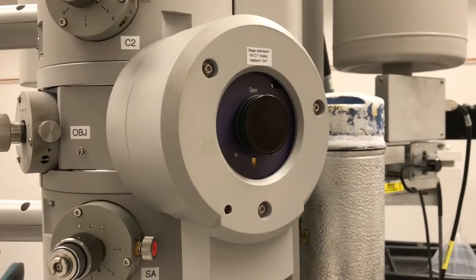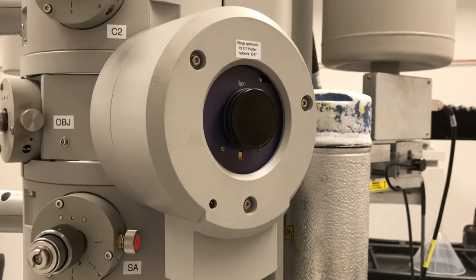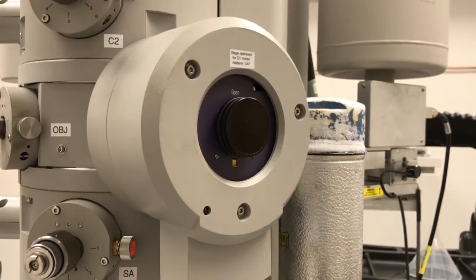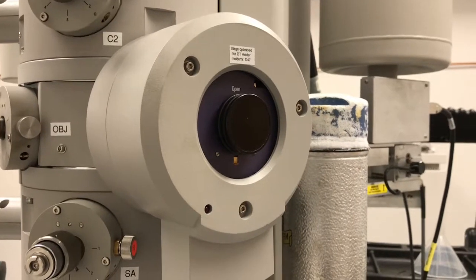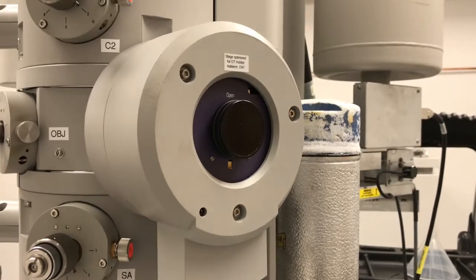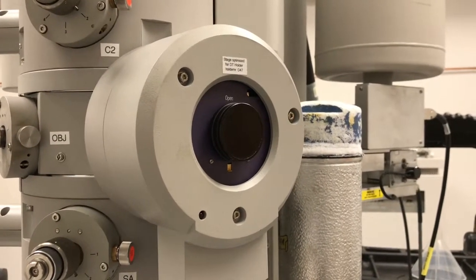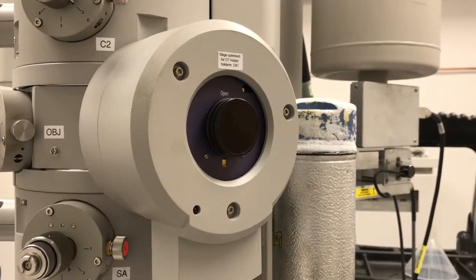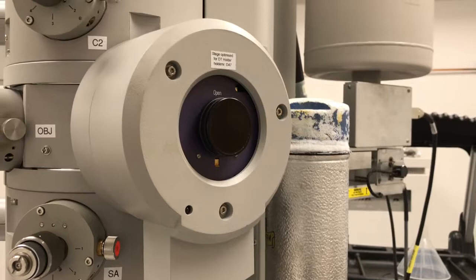That is how the holder should be inserted and extracted. It's important to keep in mind that vacuum crashes don't happen unless there's a mistake done in the procedure. They don't just happen out of the blue for no rhyme or reason. There was a mistake made somewhere in the process. You were pulling when you should have been turning, or vice versa, or you didn't apply pressure where you should have applied pressure. So vacuum crashes don't just happen at random.